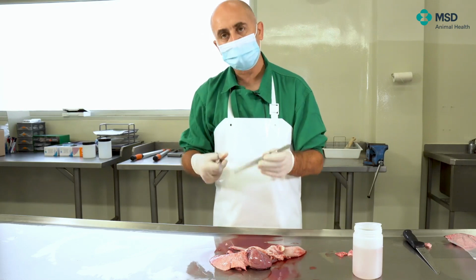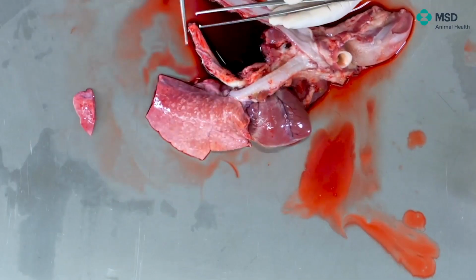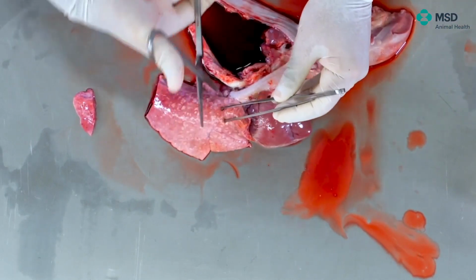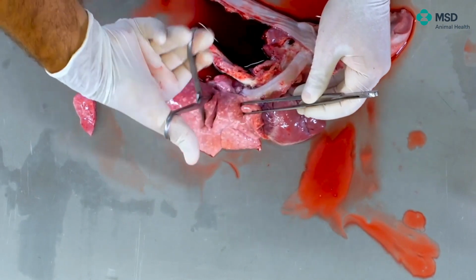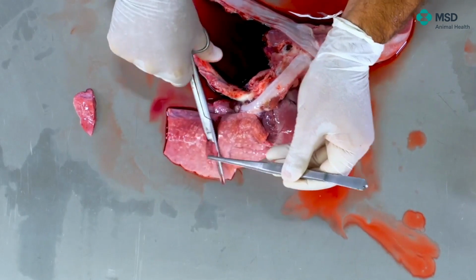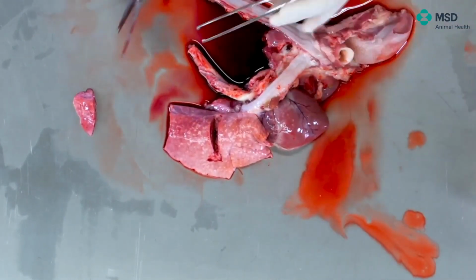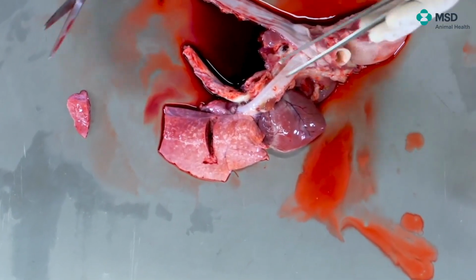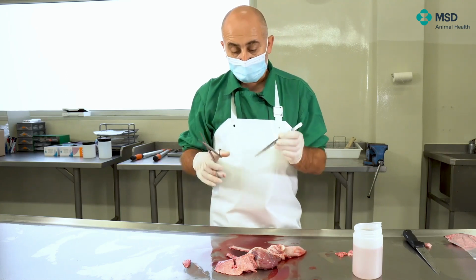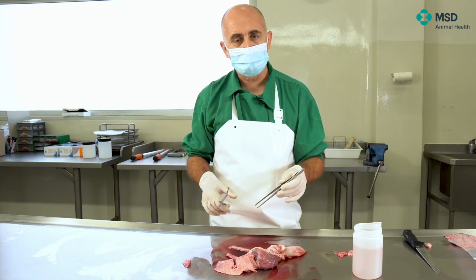We do the same with the middle. So we discard the tip and we take another sample of lung. And finally, the diaphragmatic part. For the diaphragmatic part, it's very easy to do this. But this sample is useless, almost, because it's extremely difficult to find anything there. So we always prefer the cranial part, and one possibility would be to make a cut that way in order to have also diaphragmatic lobe. Of course, we can take as many pieces of lobes as we want.